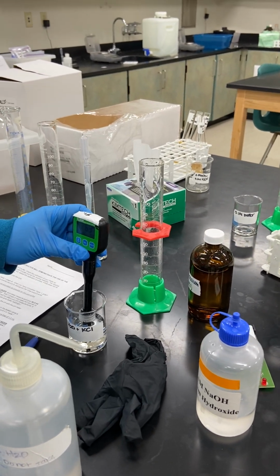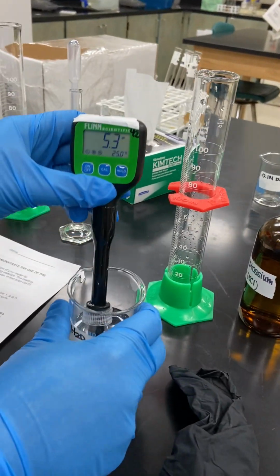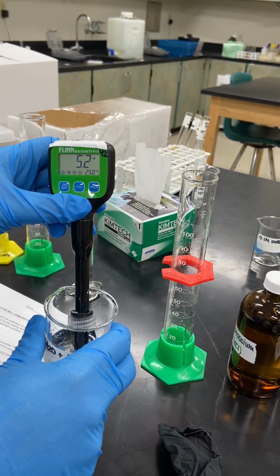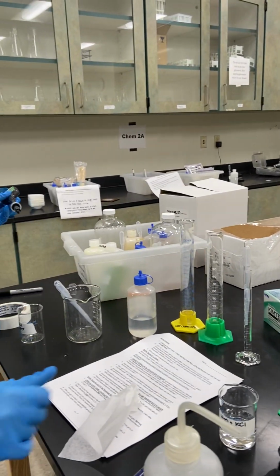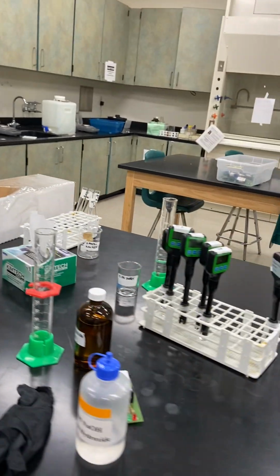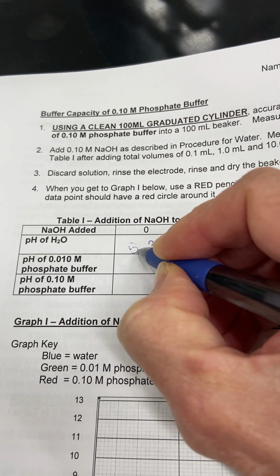What's that? It's like 6. It's going down. Can you kind of turn towards me? Yeah, thanks. Okay, 5.3. It's going down too. Yeah, it looks like it's 5.2. All right, 5.2. So we'll go 5.2. Do you want to fill it out, or do you want me to? It might be easier if you filled it out. All right. Can I use this one? Yeah. Okay, so pH of H2O is 5.2.